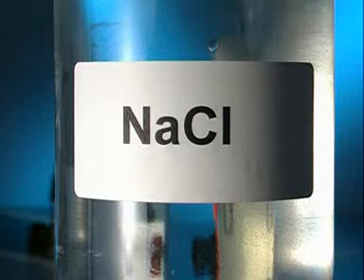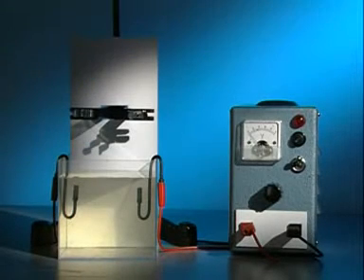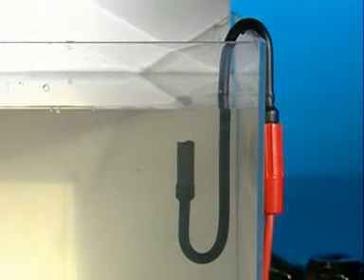To work out what's going on, here's a much simpler setup in the lab. Two electrodes immersed in sodium chloride solution are connected to a power supply. The electrodes are made of carbon and they're supported by an insulated hook.